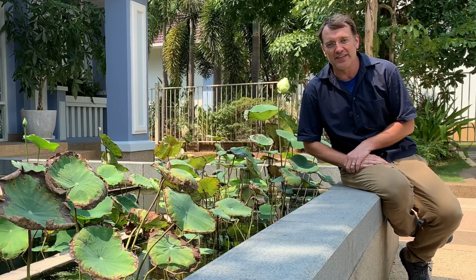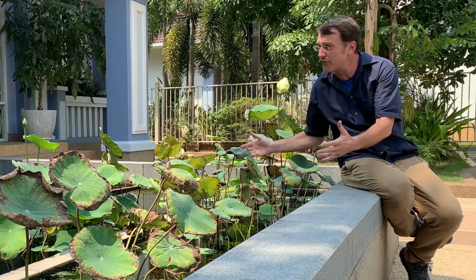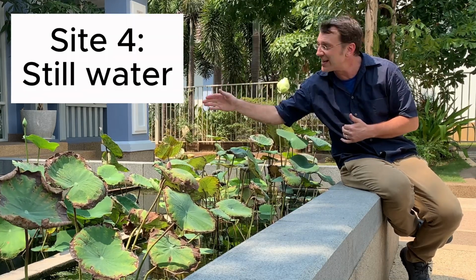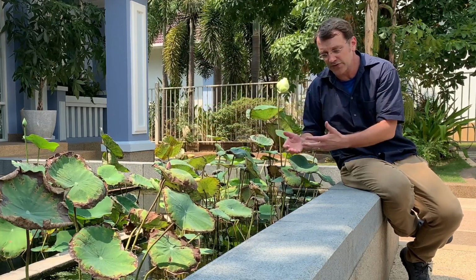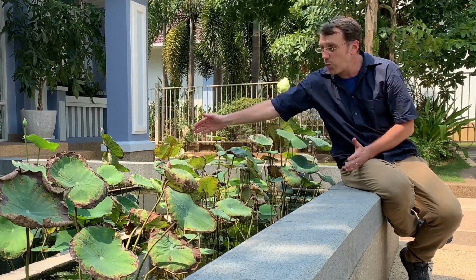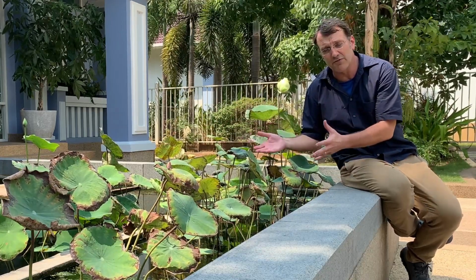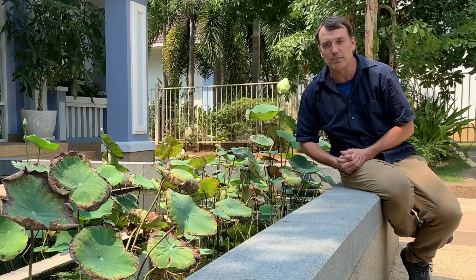And last but not least, the last site we're going to investigate is this portion of the same pool of water. And this spot is as far away as we can get from where the water falls in to the pool over there with all the bubbles. So this water is very slow moving. See, it still has aquatic plants in it, but we've walled off the fish, so the fish can't come in here at all. We're going to see if there's a difference in dissolved oxygen of this site, the falling water, or two different pots, different species of aquatic plants living in it.